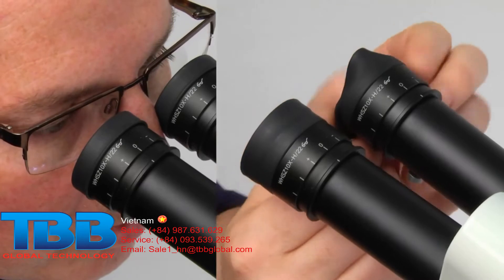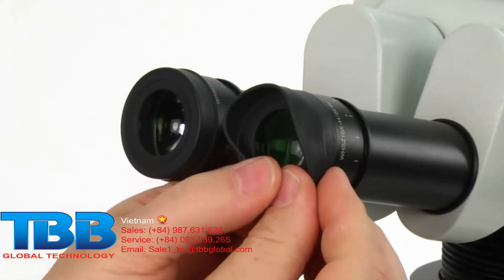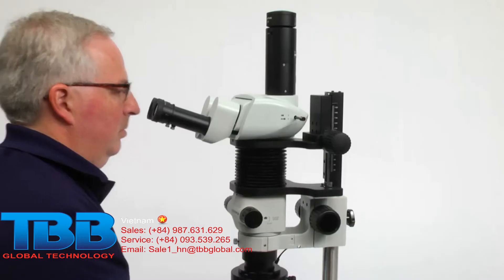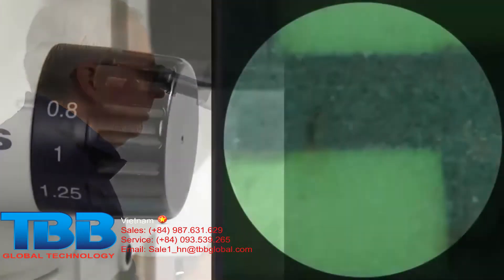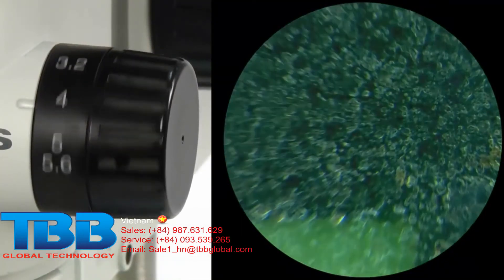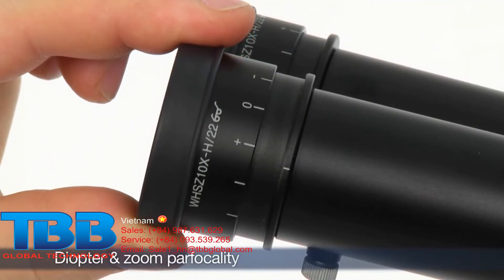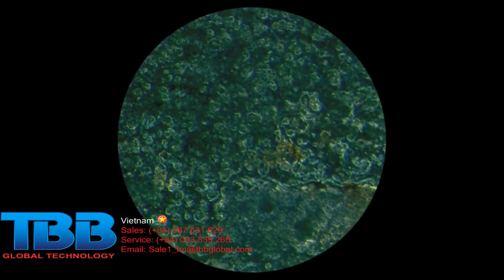For operators who wear glasses, Olympus recommends using the eye shades in the normal fold-down position to help prevent eyeglasses from being scratched. Next, the stereo microscope must be properly focused to provide a clear image from low to high magnification. The diopter and zoom parfocality must be properly adjusted to provide consistently clear images through the range of magnifications.